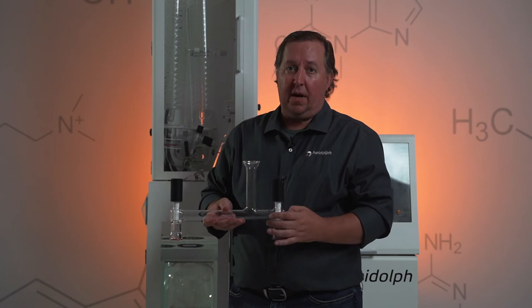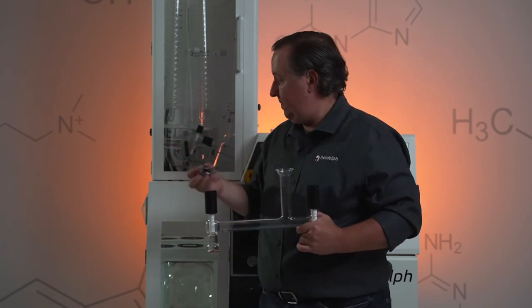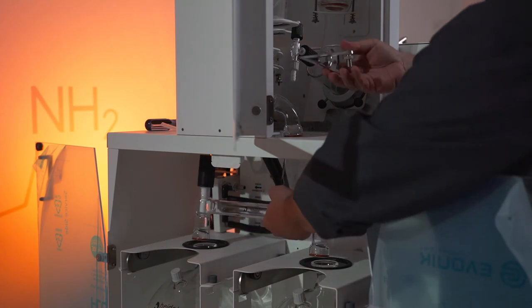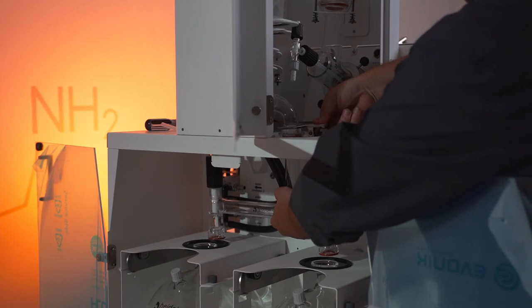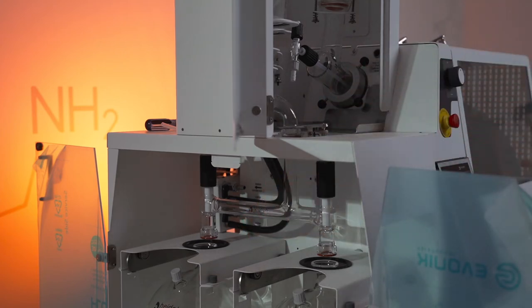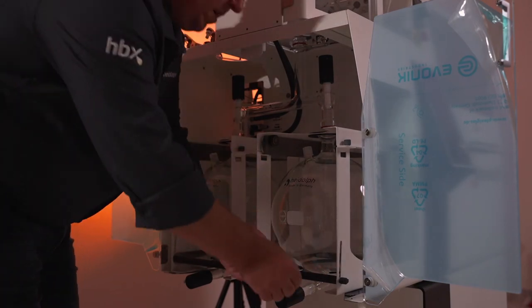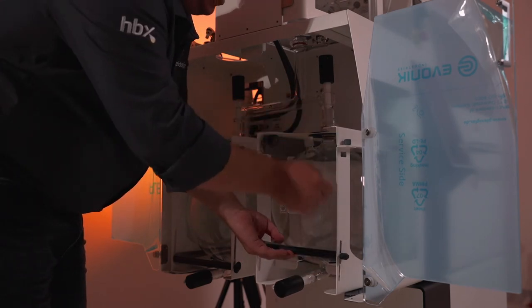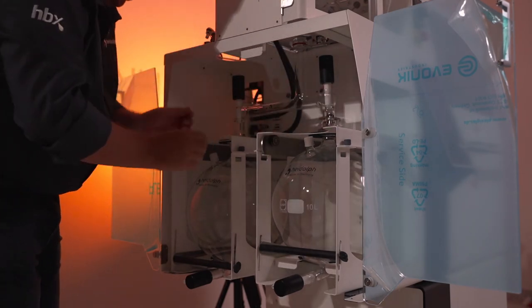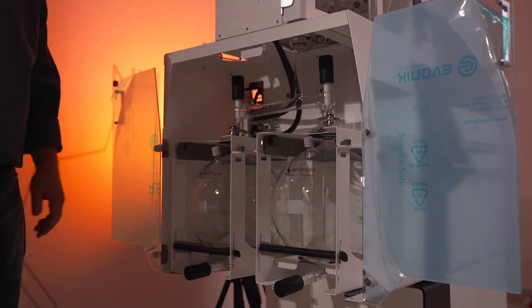The final step for installing our glassware is installing the H distributor. You're going to need the H distributor and then three KS40 clamps. Take our H distributor and connect the top piece to our Y-joint using our KS40 clamp. Get that in position, get the clamp in place, and screw down that little screw — that'll hold this glassware in place so we can align our collection vessels. Grab the collection vessel by the bar, bring your glass into position, lock the wing nut, take your KS40 clamp, get that in position, and do the exact same for the back collection vessel. That completes the installation of our glassware.